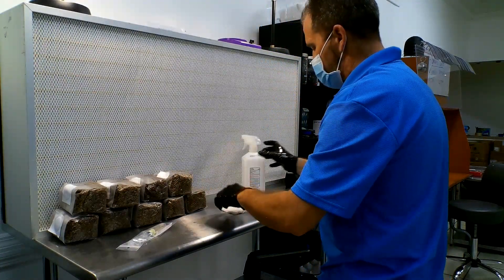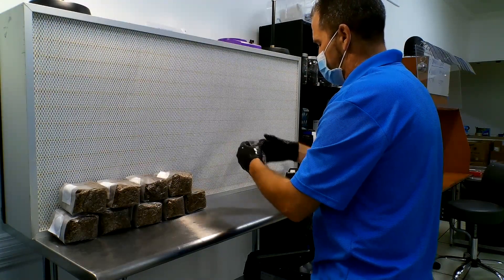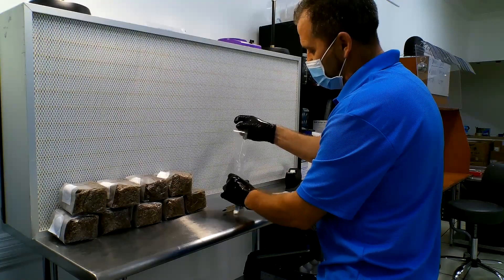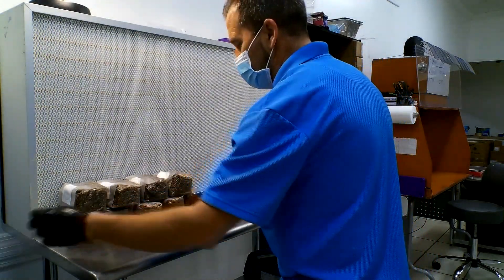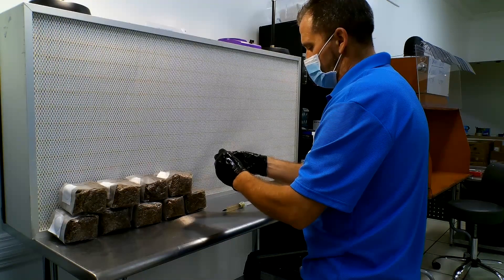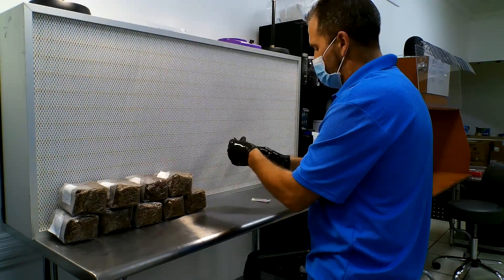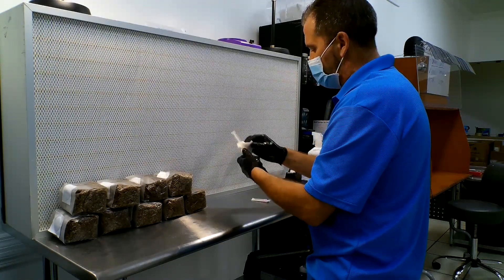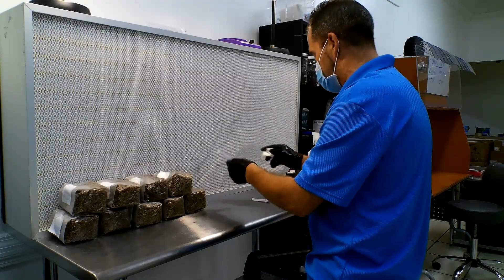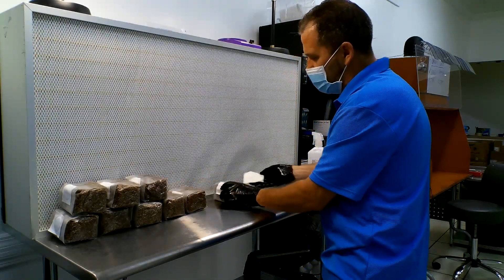We've got our rye berries here. We're going to open up our liquid culture syringe, which comes with a sterile, individually packaged needle. I'll set these right here. We're going to wipe down the syringe — you want to wipe down everything. The more particulates you can get rid of before you even attempt to inoculate, the better. If you don't have a flow hood, just make sure you wipe down and spray with Lysol or alcohol really, really well. Now I'm going to go ahead and wipe the spot I'll be injecting on each bag.